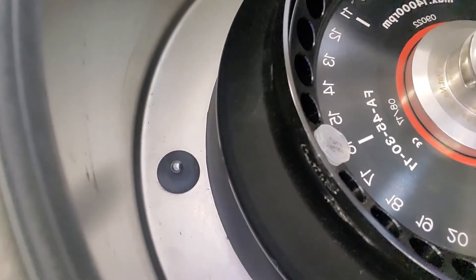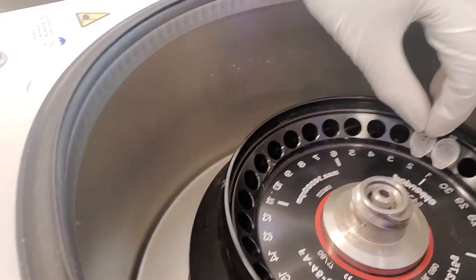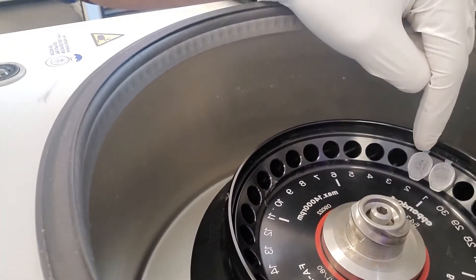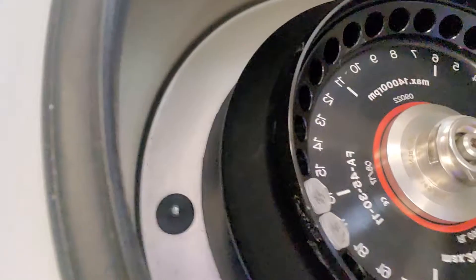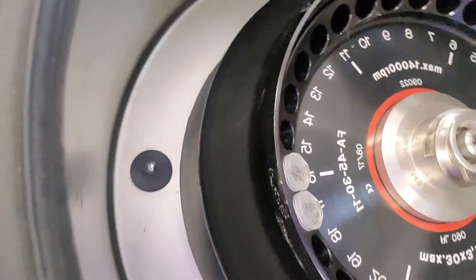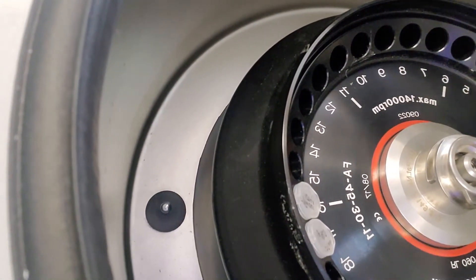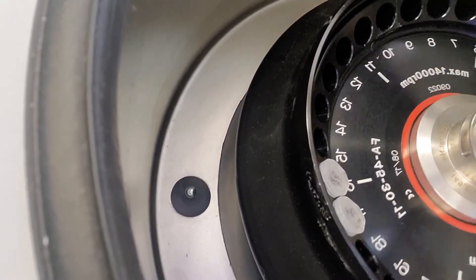My third tube I'm going to put in the number two spot, hinge out. Adding one to position one puts me in position two. So I'm going to add one to my 16 spot, which puts me in position 17. This is now a balanced centrifuge, so I have satisfied rule one. Whenever things are in here, they're on the opposite side and they're balanced. You start with one, put tubes to the right, and every other one goes on 16 and then to the right.